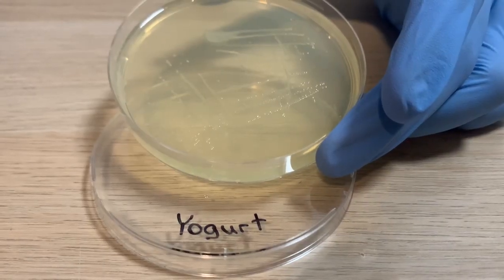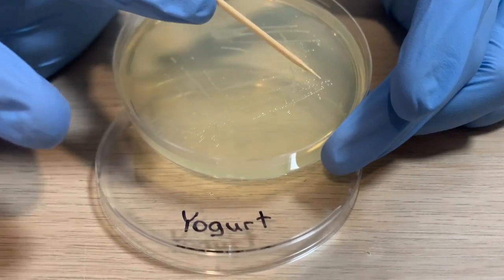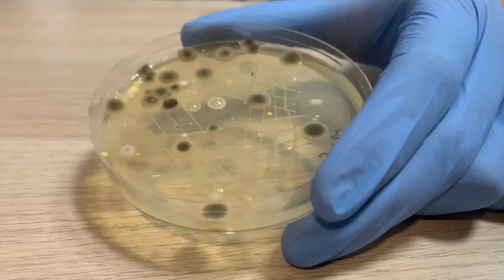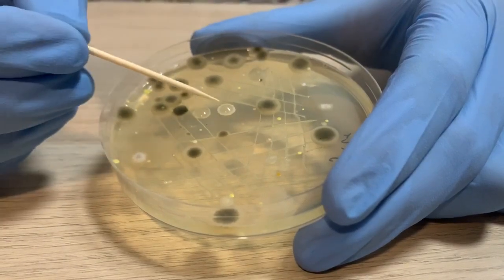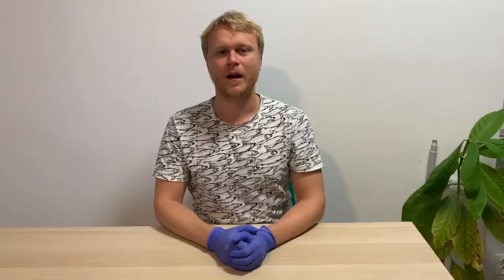Sterile conditions and usage of the streak method allowed us to obtain small but clean and nice colonies of Lactobacillus and Bifidobacteria. Without sterile conditions, our yogurt would be contaminated with fungi and other bacteria species falling from our hands. After analysis of your bacteria, we recommend using household bleach to destroy the bacteria and dispose of the petri dish. Thank you for being with BioBranches. We hope you liked it.